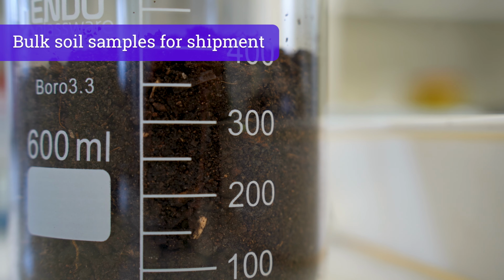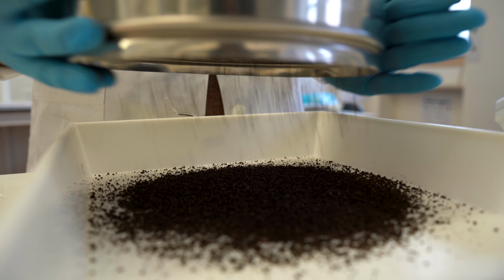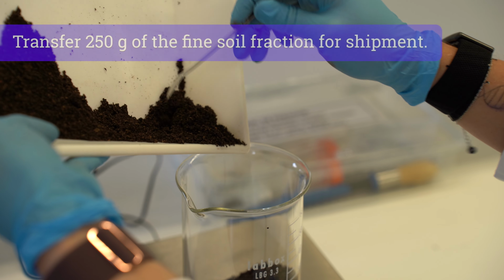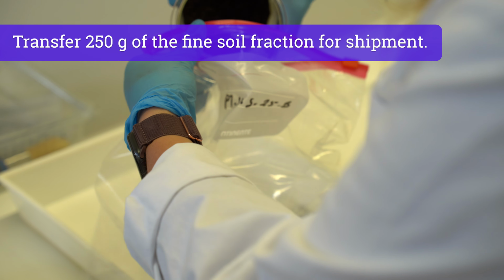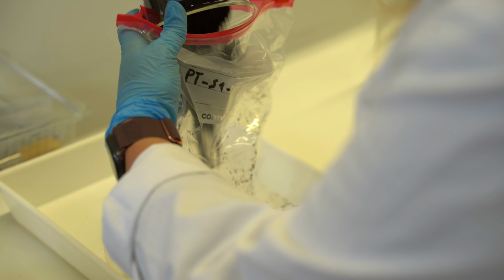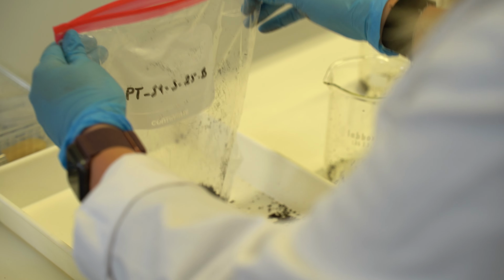Sieve at least 400 grams of the homogenized bulk soil sample through a 2 mm mesh to remove coarse particles, stones, and roots. Transfer 250 grams of the fine fraction into a properly labeled zipped plastic bag. Leave the bag open to air dry at room temperature and store it in a clean, dry environment until shipment.